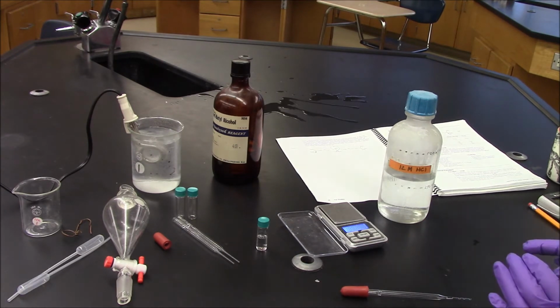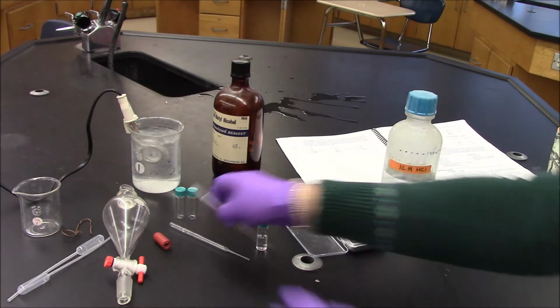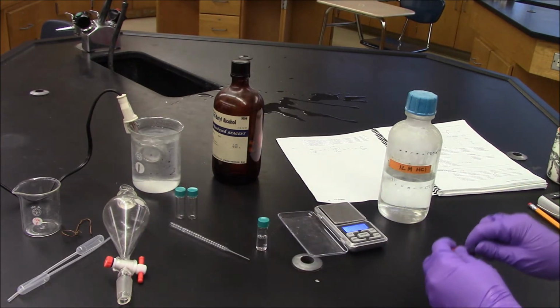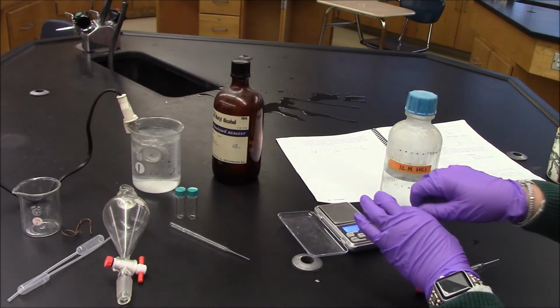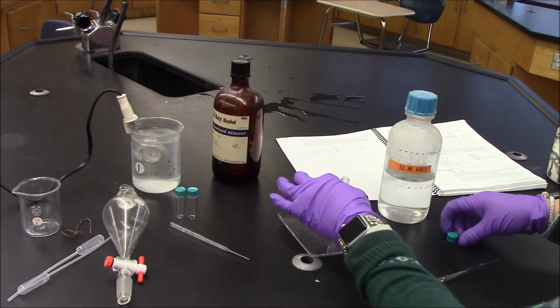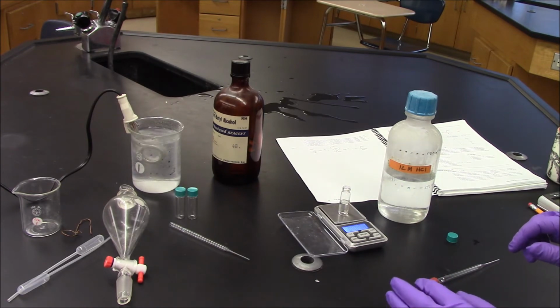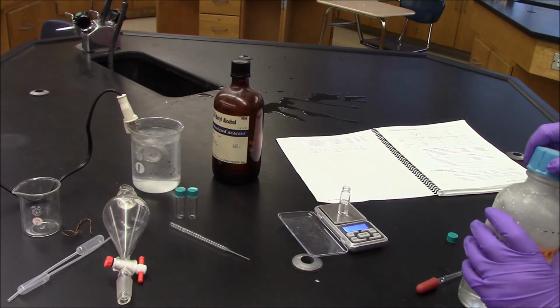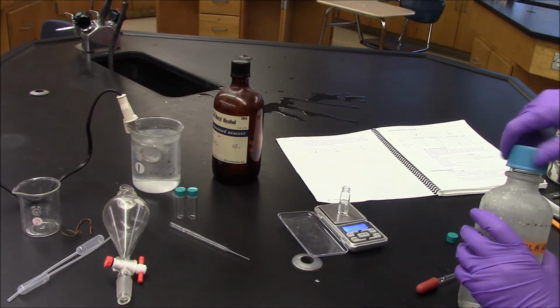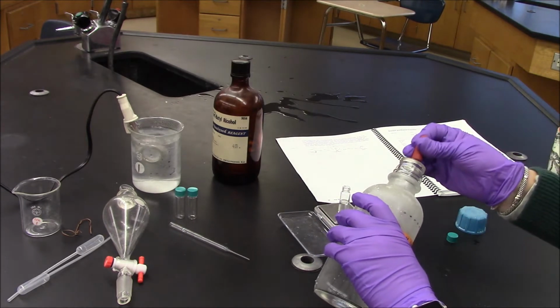Okay, here we go. Hydrochloric acid is nobody's friend. Should always be exceedingly careful. So I added 1.6 grams of the alcohol. And now using the density, I'm going to add 2.4 grams of the acid, which should be equivalent to 2 milliliters.